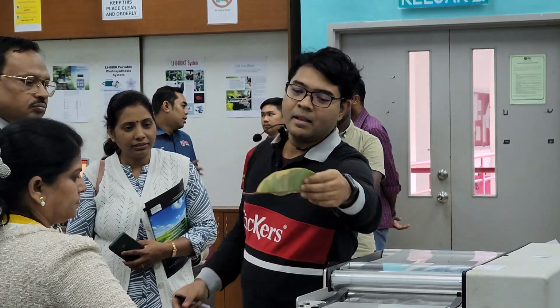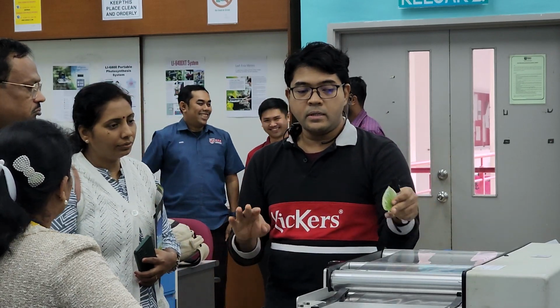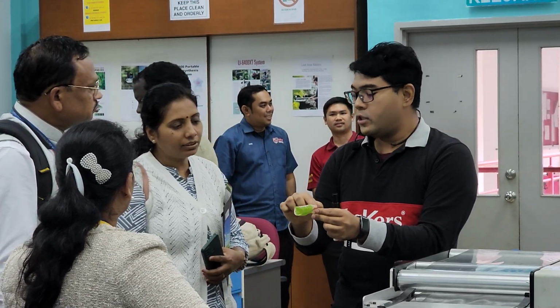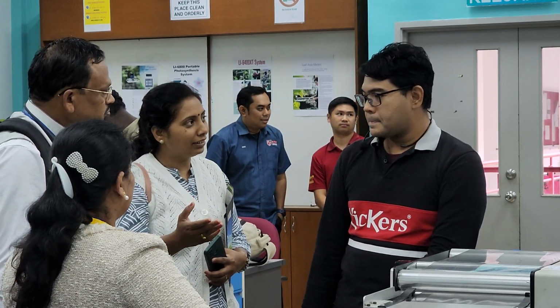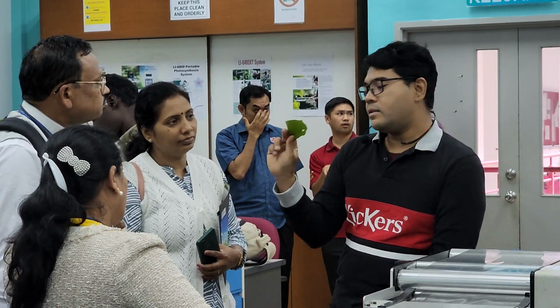And what about the yellow area? Does it only count the green area? No, this machine does not discriminate based on color. It is actually measuring the silhouette of the leaf, the shadow of it. So even if you put an orange leaf, it will still measure. But if the leaf is affected by insects and disease, we cannot see the functional area. Like this one, you got a hole, so it's not going to measure the hole.